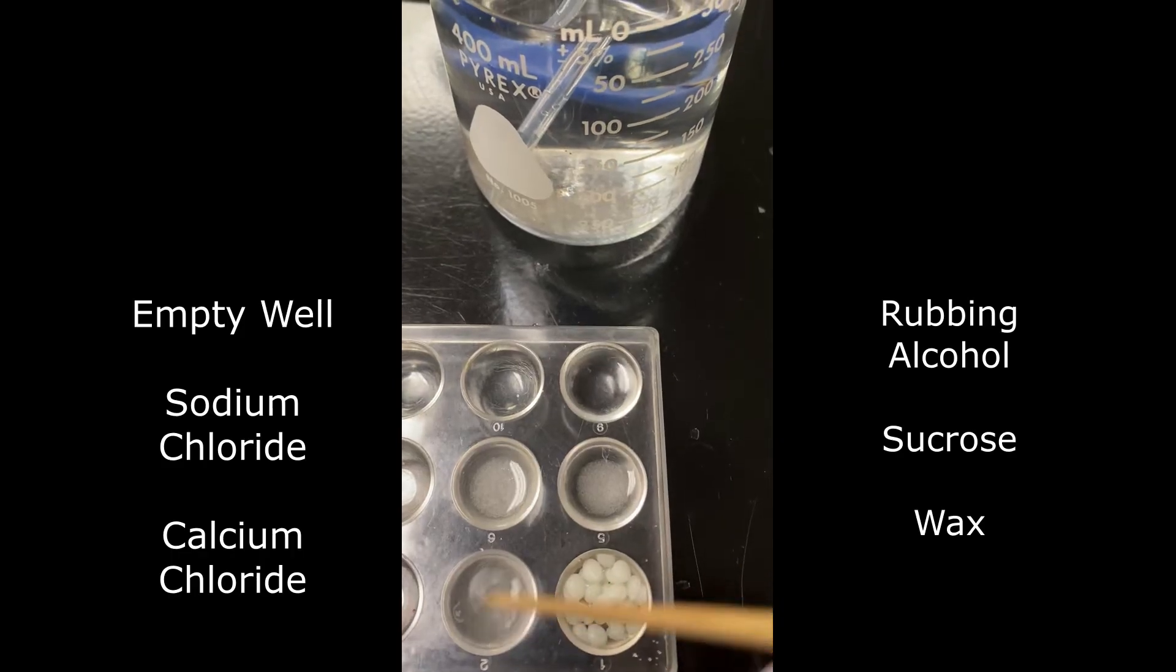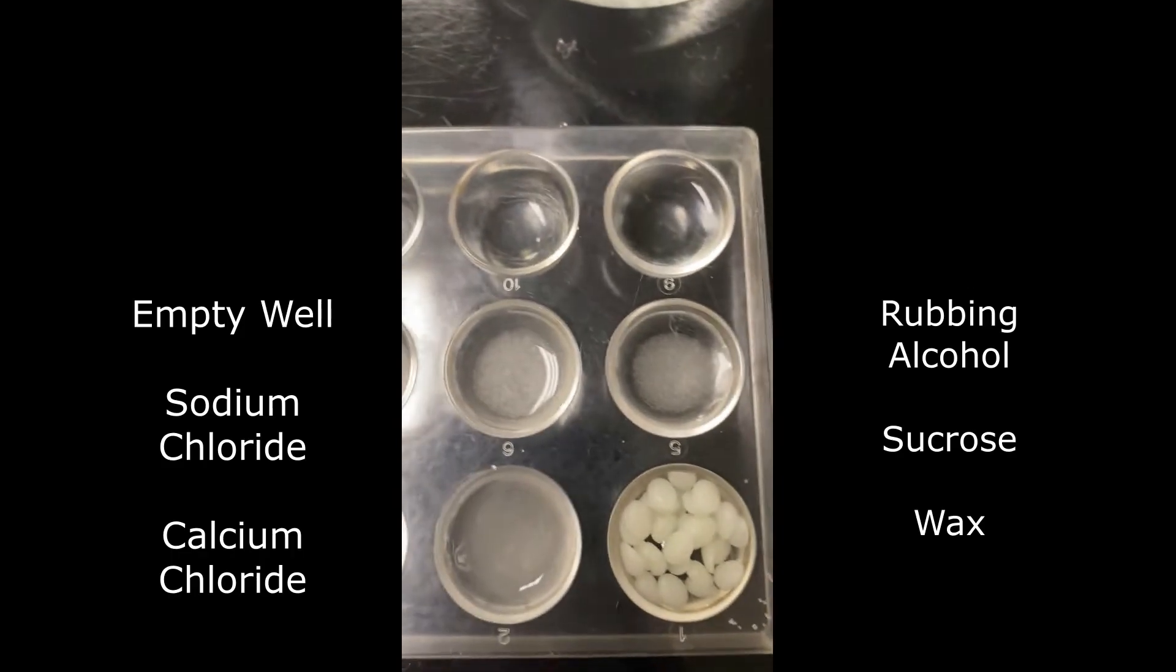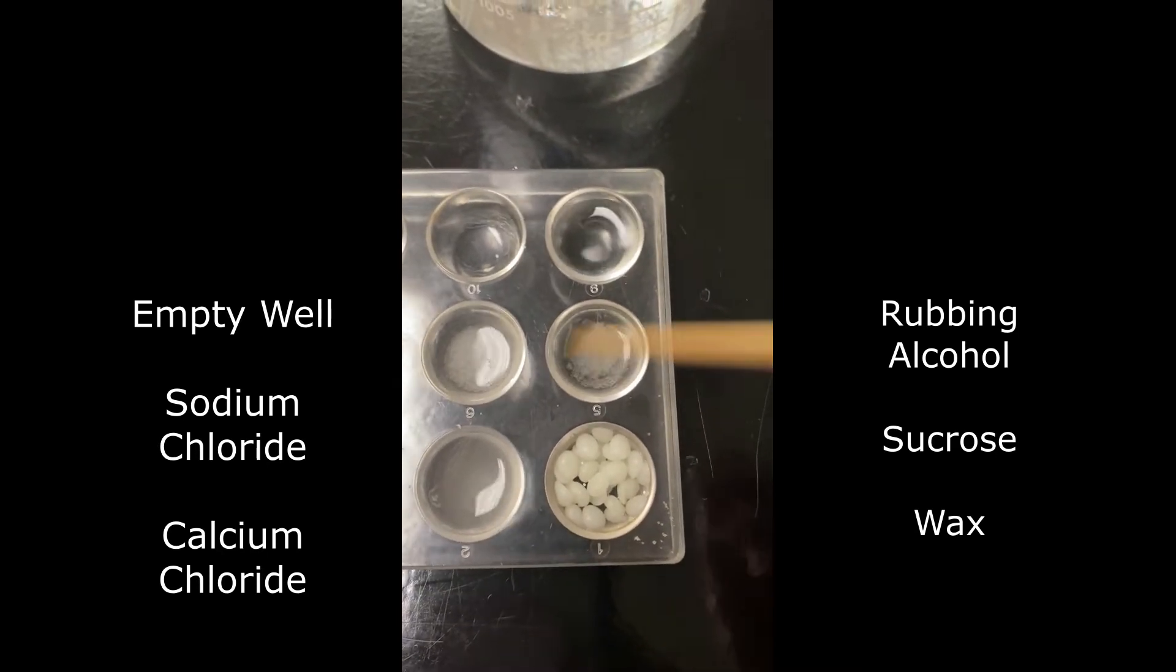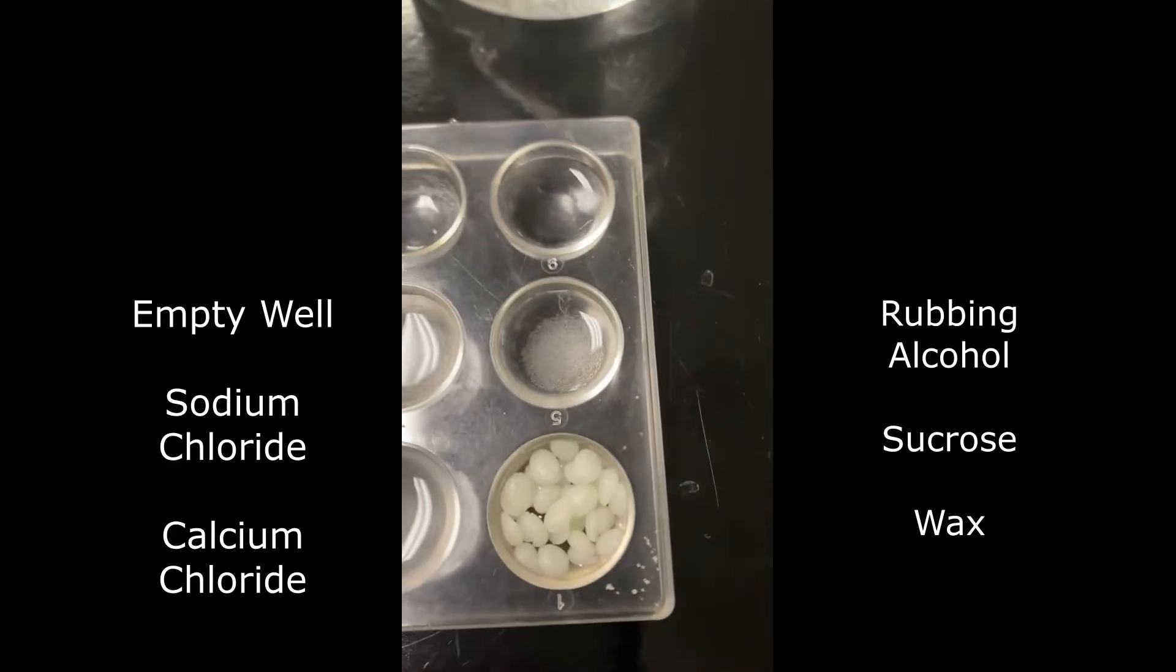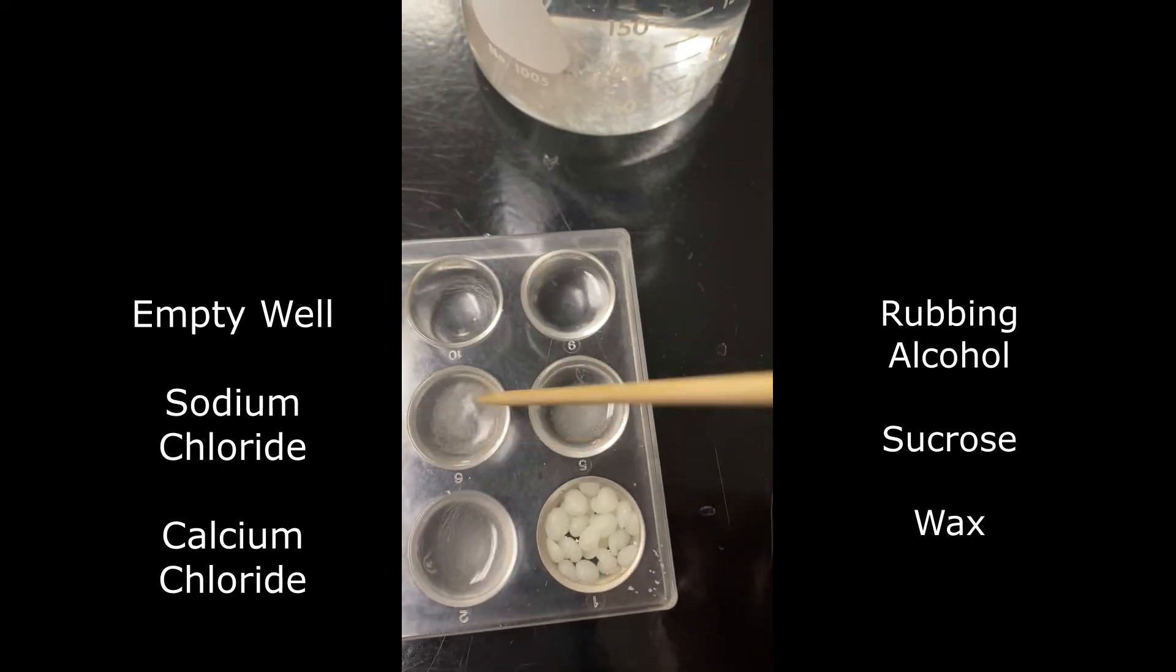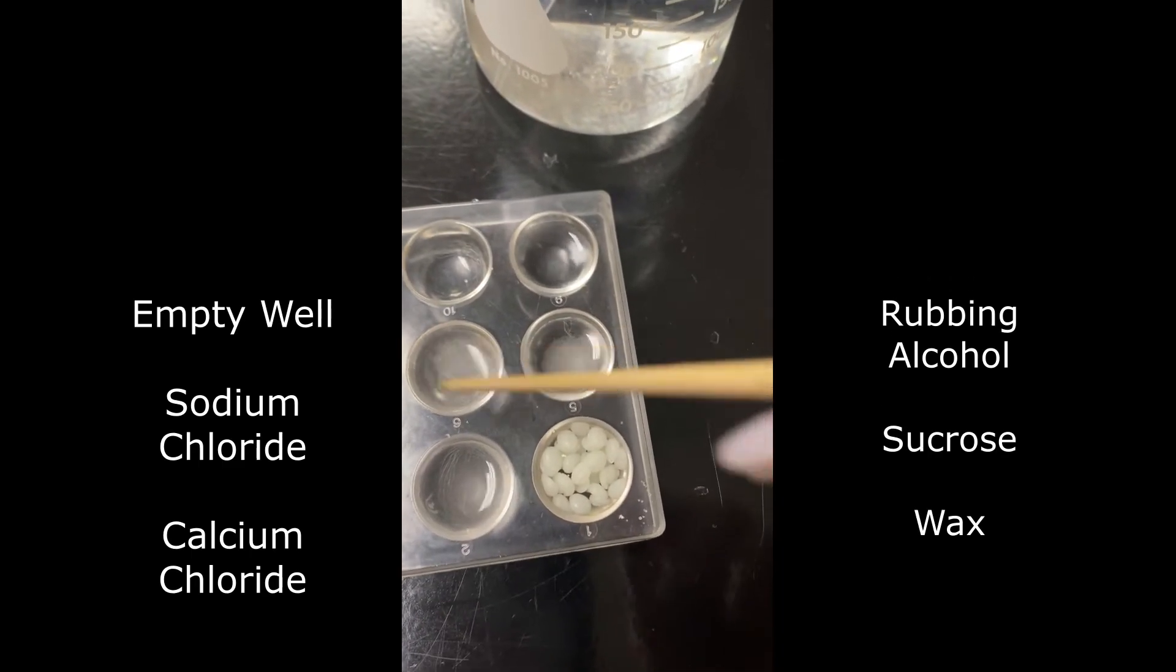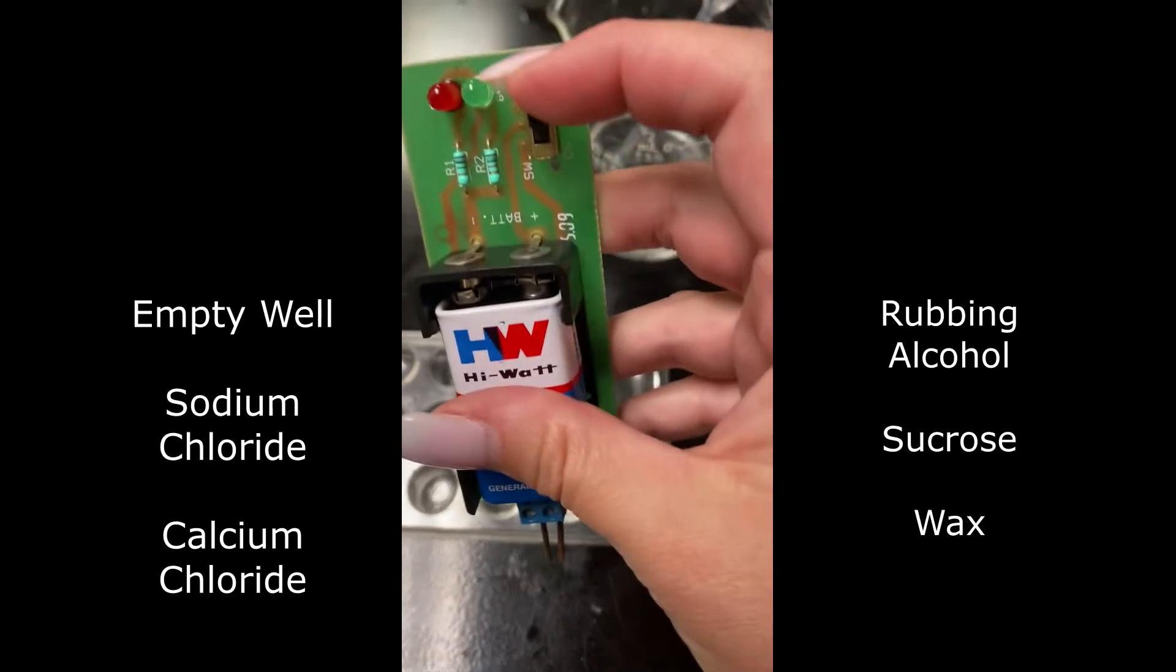But I do want to mention we are using tap water instead of distilled water. If you use distilled water, your conductivity should be zero with distilled water. So if you can get it, go ahead and try it. With tap water, there are trace minerals, including metals. So we're going to end up with a little bit of conductivity, even on ones that aren't supposed to truly conduct electricity. So let's take it with a grain of salt.